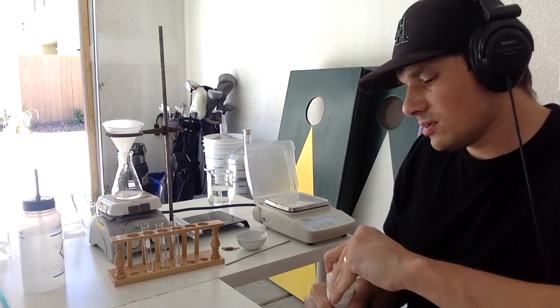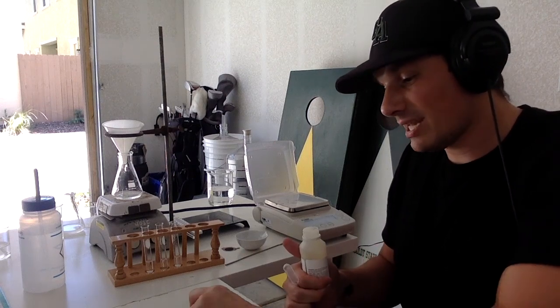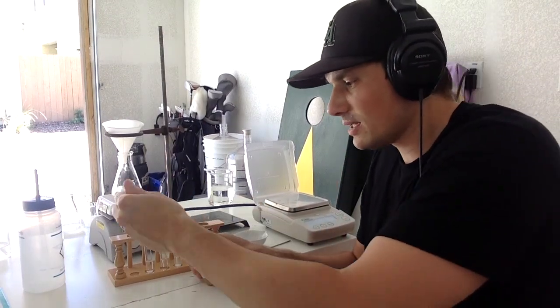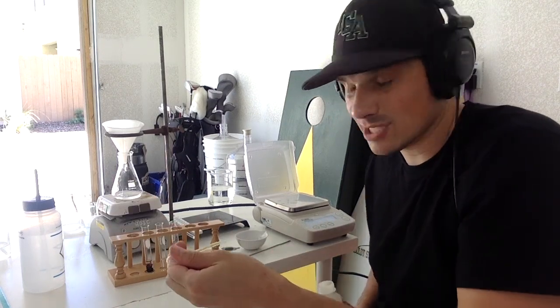Okay. So this is my iron chloride. The cool thing is, once that chloride hits the 50% water, the chloride is going to dissolve into the water, leaving that iron 3, that 3+ ion. And that's what's going to react. So we can see it's purple.